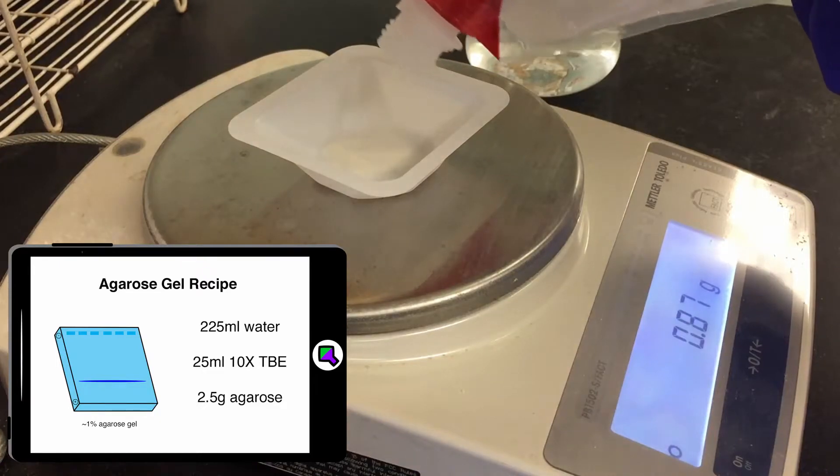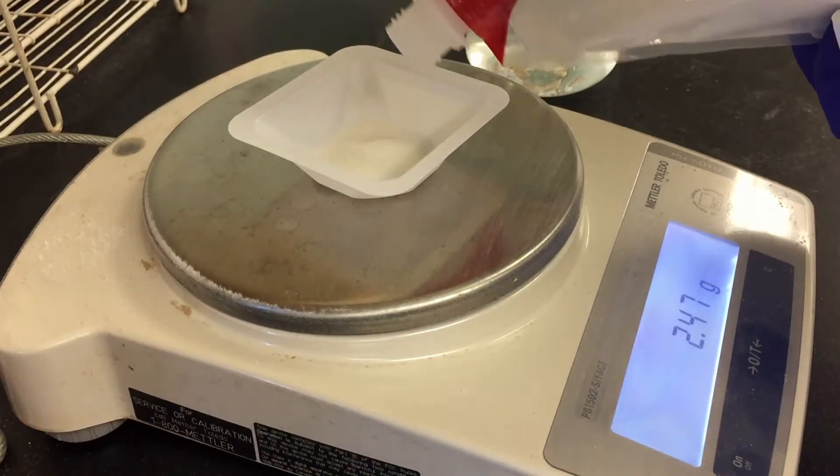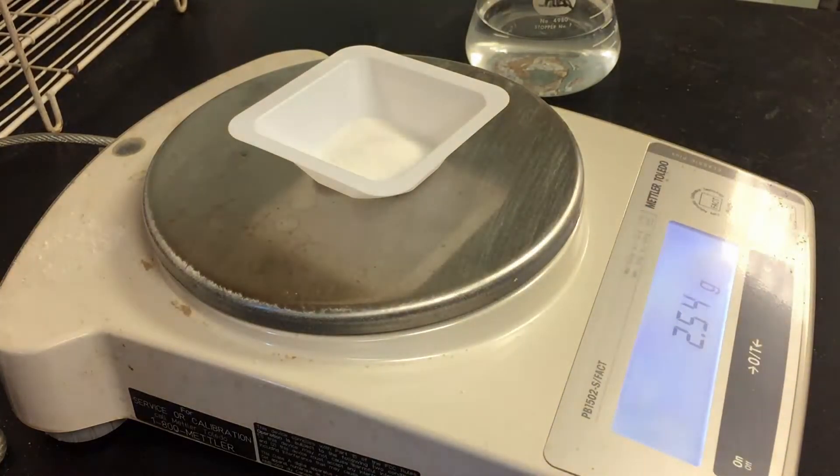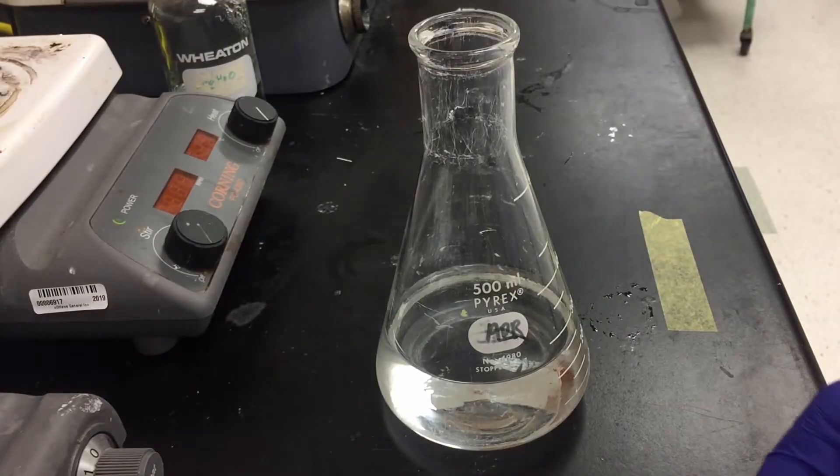Here you can see I've measured over 2.5 grams so I'll be slightly over my goal of one percent but it's insignificant for checking if there's a PCR product or not.